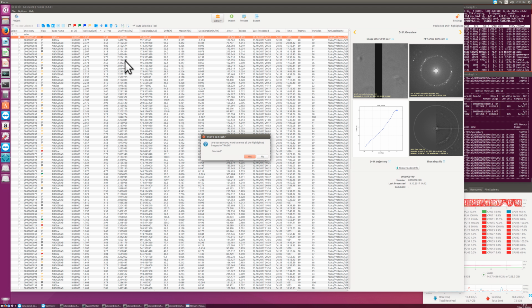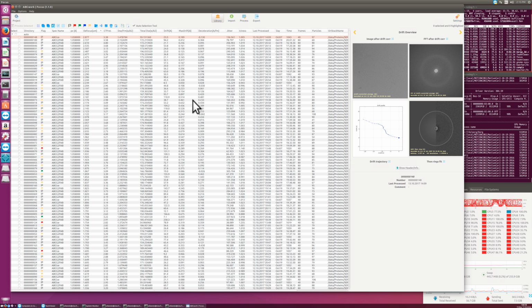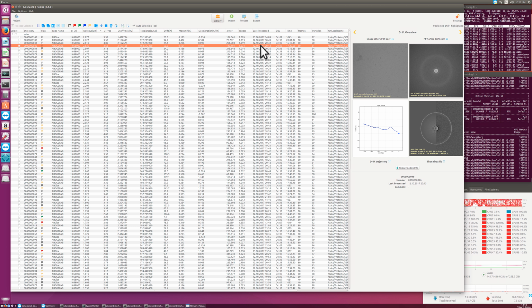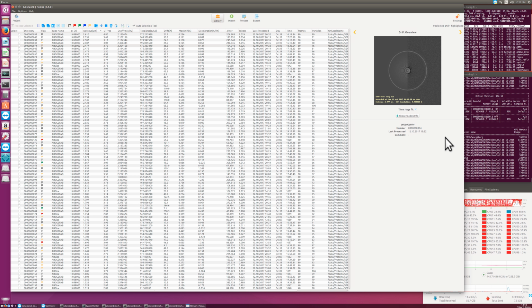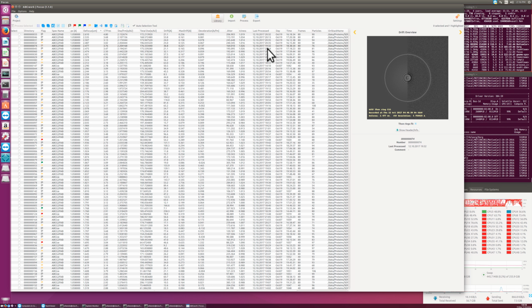Again, I'm recording this movie on a Macintosh with Focus running on an Ubuntu Linux computer, and I'm displaying this here with TeamViewer, and the display connection is a bit slow. So all these files here, these are previews for wherever you are in which line, and you can always look at them for the entire fields here. But now we have a real issue with the TeamViewer connection.